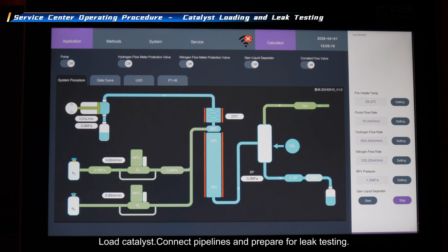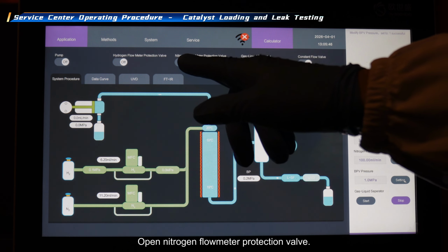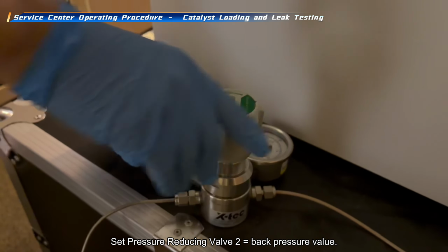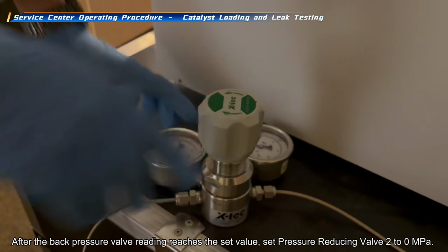Load catalyst, connect pipelines and prepare for leak testing. Set back pressure valve to 1 MPa for reaction pressure 0-4 MPa or 4 MPa for reaction pressure 4-8 MPa. Open nitrogen flow meter protection valve. Set pressure reducing valve 2 equal to back pressure value. After the back pressure valve reading reaches the set value, set pressure reducing valve 2 to 0 megapascal.